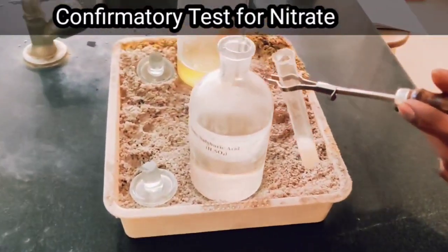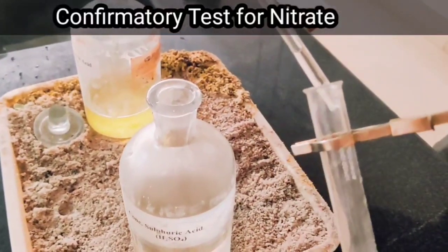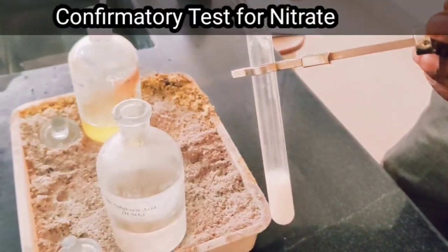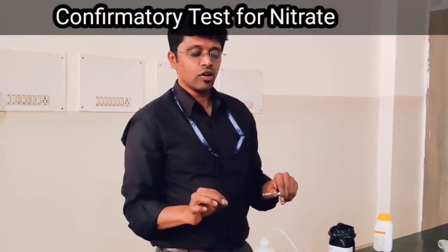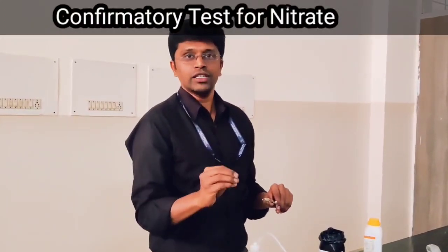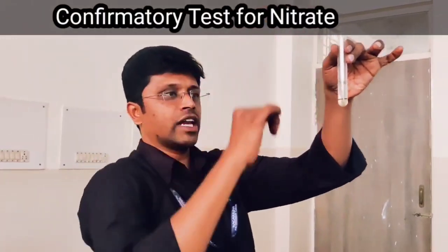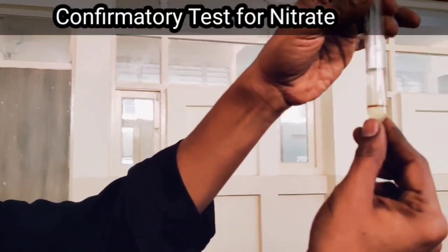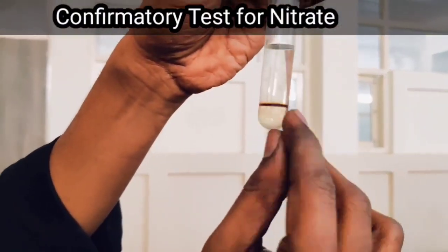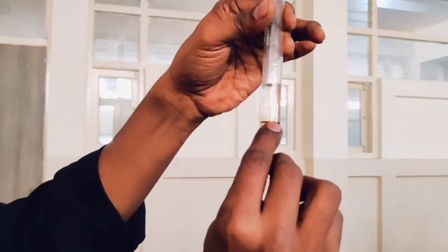Add concentrated H₂SO₄ along the sides of the test tube without shaking. After adding concentrated sulfuric acid, we keep the reaction mixture for a few minutes so that the brown ring will appear. We can notice that there is a formation of a brown ring at the junction of the two liquids. This brown ring indicates the confirmation of nitrate ion NO₃⁻.